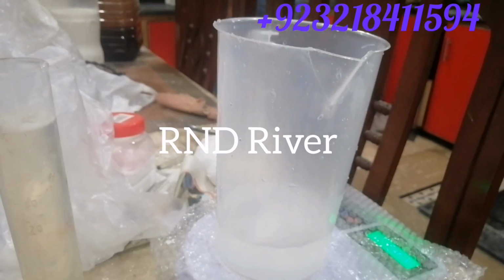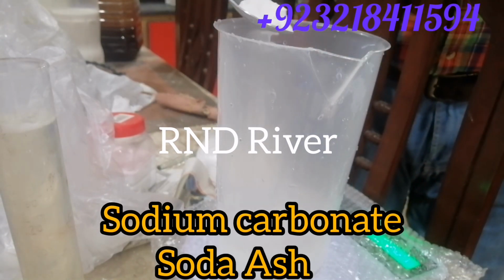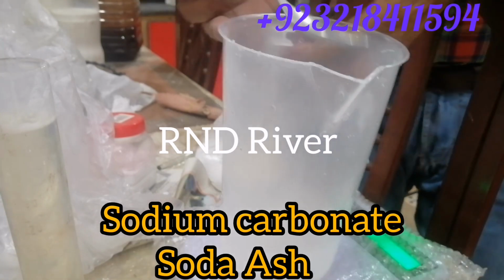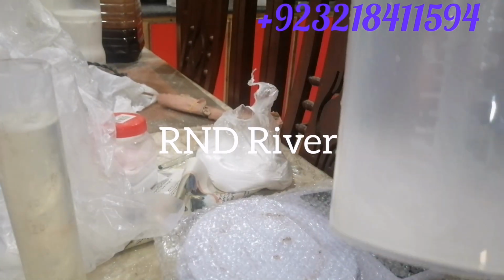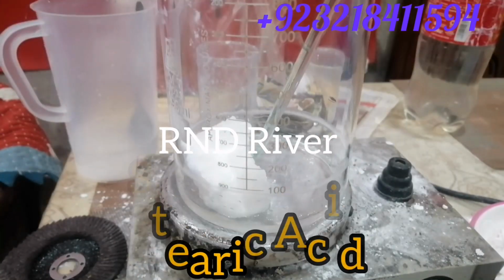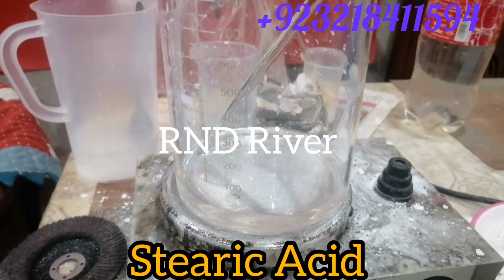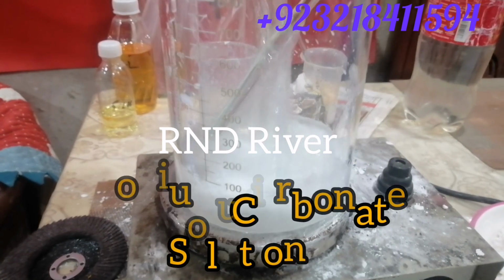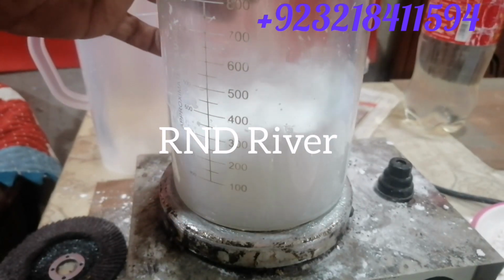In the meantime, while the temperature is rising, we have to dissolve sodium carbonate, soda ash. Dissolve well. Now come back to the stearic acid. After dissolving, we come back to the stearic acid. When the temperature reaches 60 to 70 degrees centigrade, all the stearic acid will melt, and then add the solution of sodium carbonate. This is going to make sodium stearate.